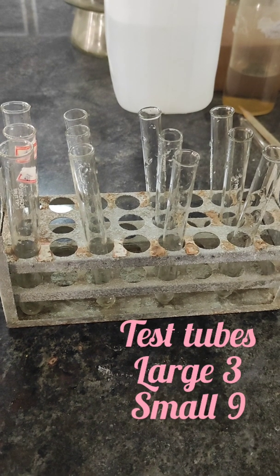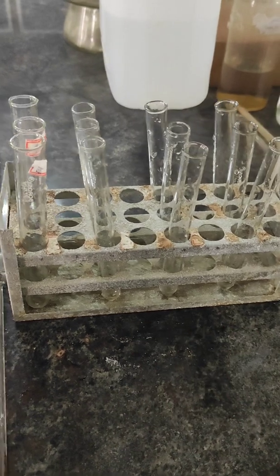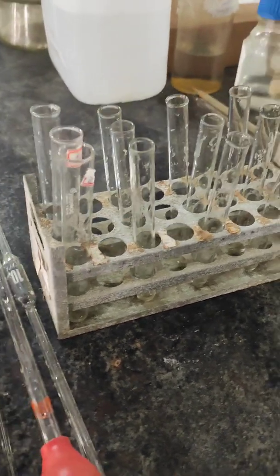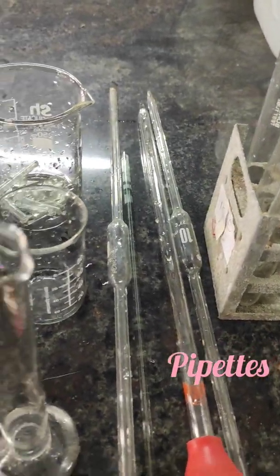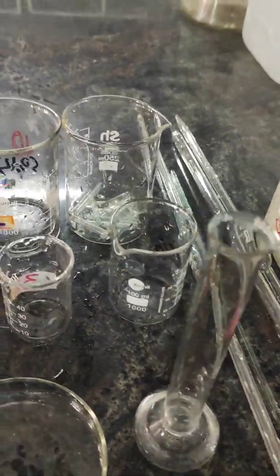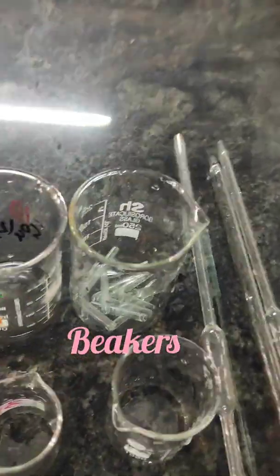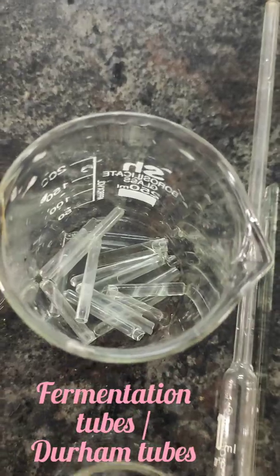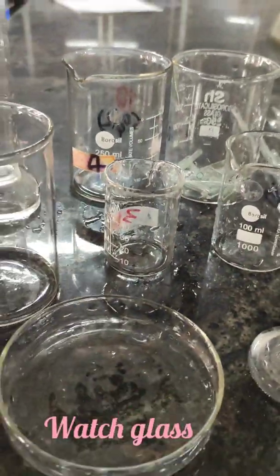For this experiment, we need 3 large test tubes and 9 small test tubes, pipettes, a beaker, fermentation tubes or Durham tubes, and a watch glass.